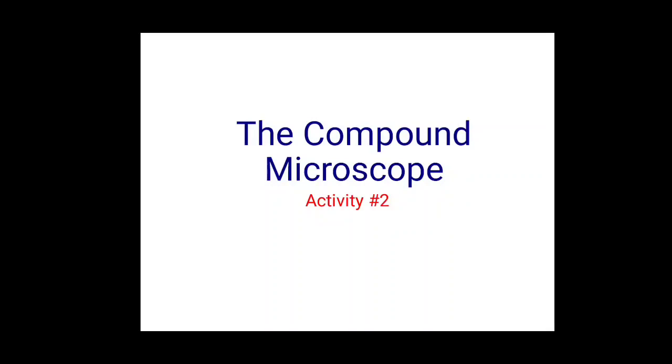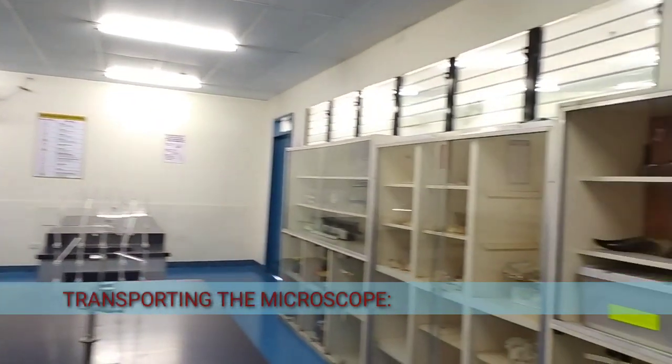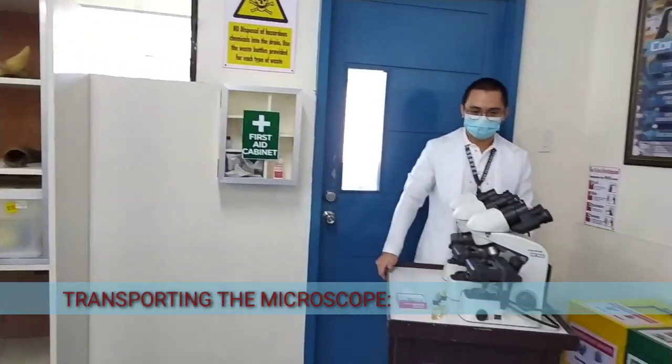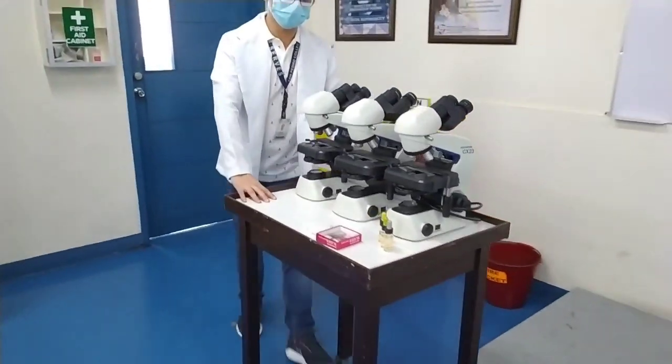A compound microscope is an expensive instrument in the laboratory. Without it, it is impossible for a laboratorian to perform essential laboratory tests. Therefore, proper care and handling is required, especially when transporting this delicate instrument. Since most compound microscopes are heavy, it is nice to know these tips on how to properly carry and transport a compound microscope to avoid accidents.